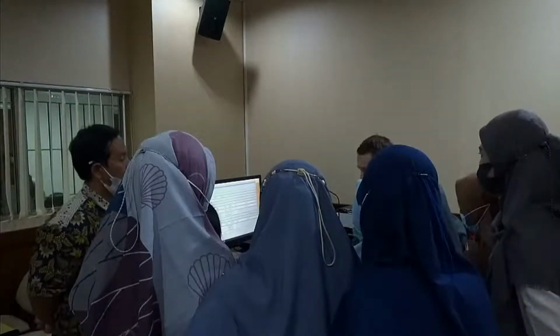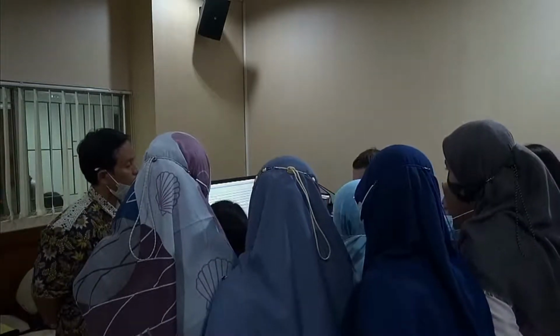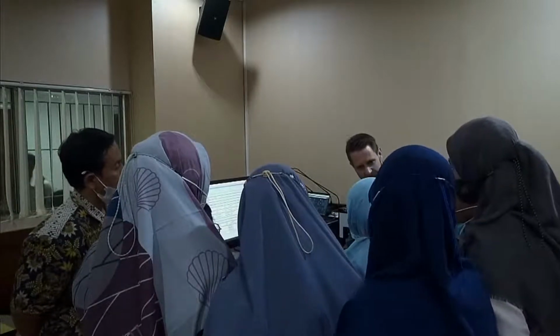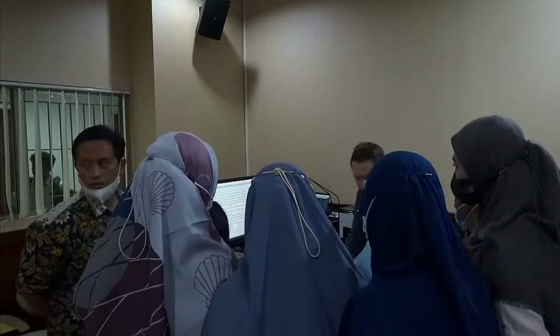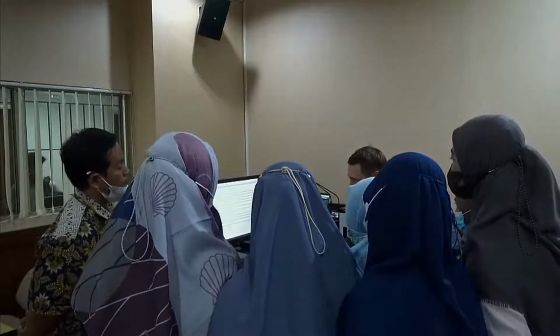So we use these values as these are, of course, from literature, and the most important thing is use the same ones. Once you find something that works for your sample, stick to it. That's the thing that counts. Make it comparable once you move forward with your measurements. Don't change it over time, because, of course, if you change the parameters, your results are not comparable anymore. So in this case, we just start here.